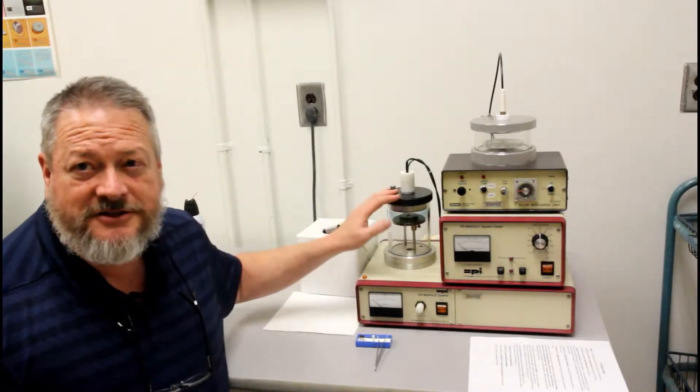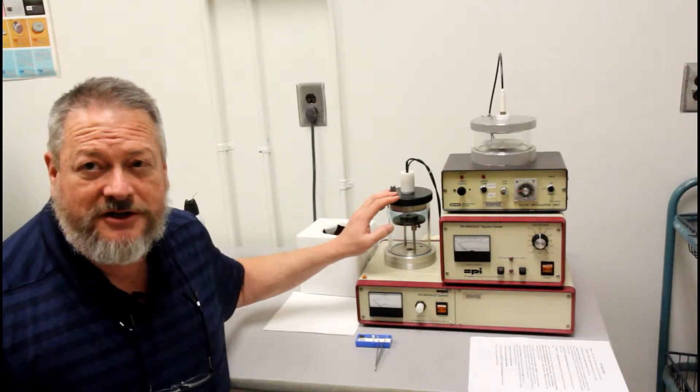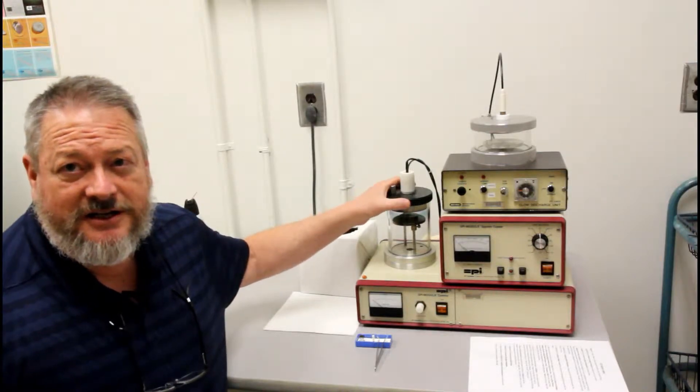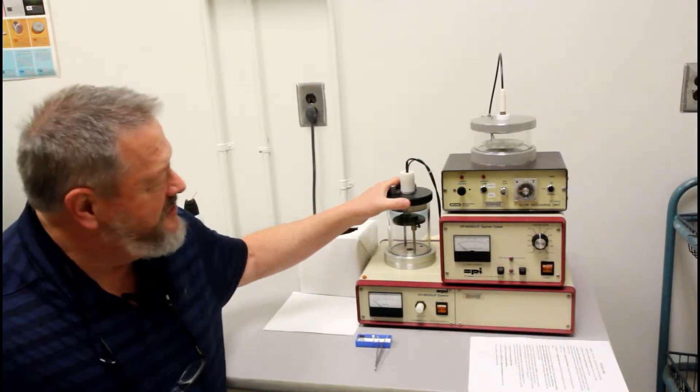When you first come in you should find the chamber already closed and ready to go. If it's not, then that means someone left it in the wrong position.